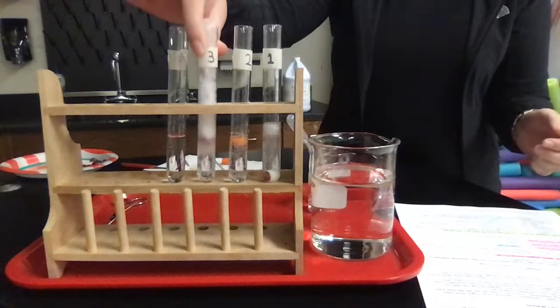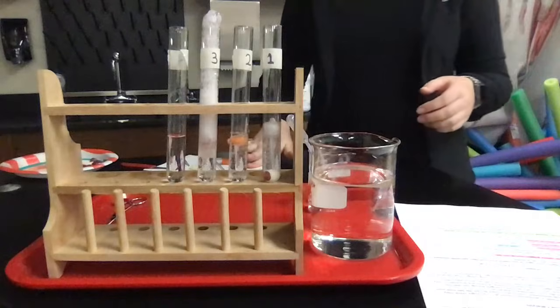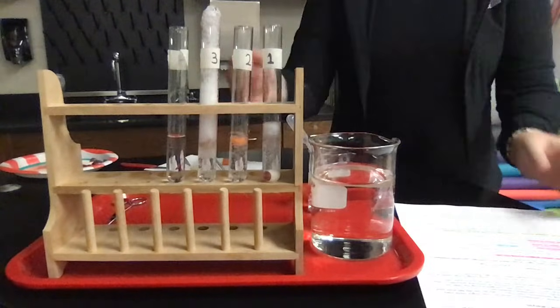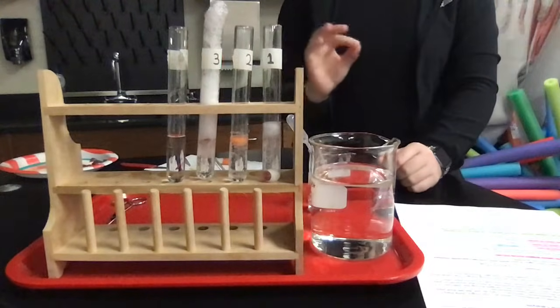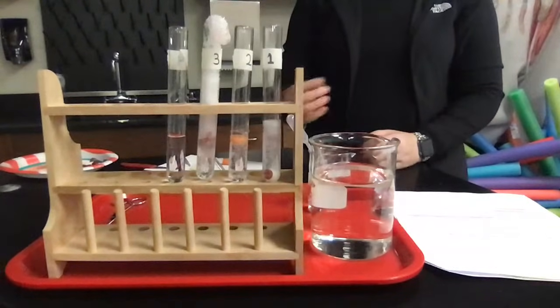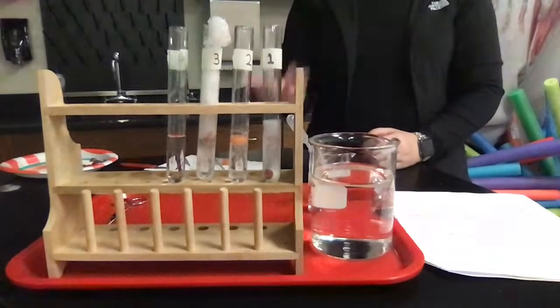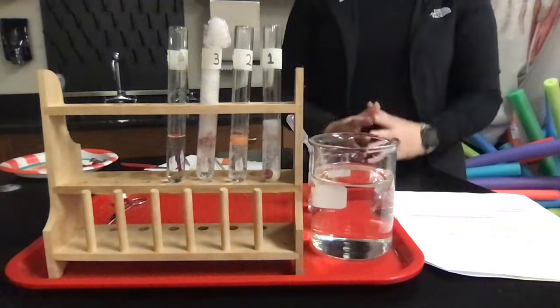I can tell you that they're slightly warm. So if they're slightly warm, what does that mean? It means that they're exergonic. They're releasing heat energy. And this one just keeps going. Look at this little guy, right? So they're slightly warm because it's releasing heat energy. Because there's heat present, it is an exothermic reaction, which means that you're giving off heat. And that's present when we have catalysis, when we have something breaking apart.